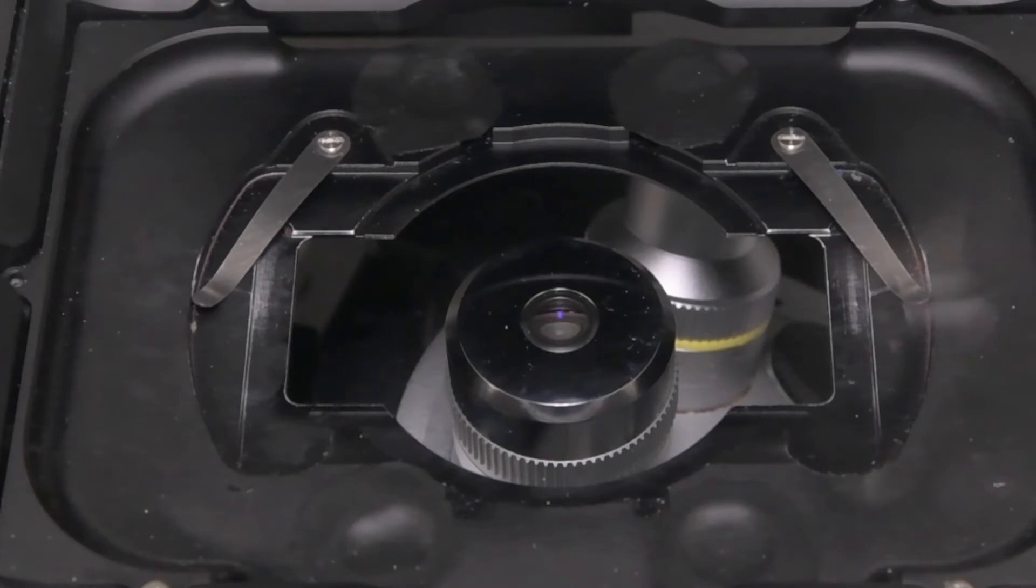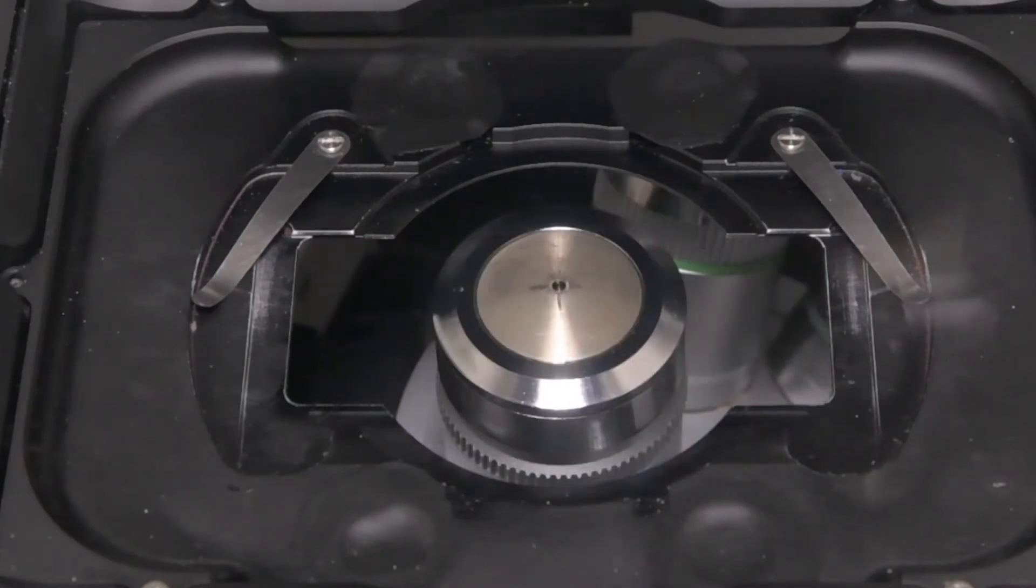So, making sure we selected the 40X oil objective, it looks like this inside the scope. It is a bit taller, flatter across the top, and there may be a skim of oil as well.